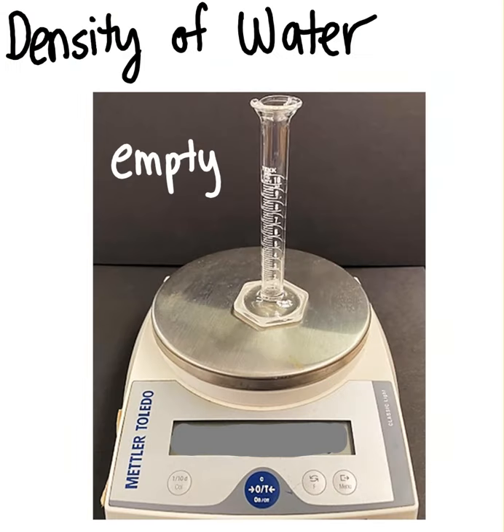Next, on the experiment, we're going to determine the density of water. On this one, we need the mass of the empty graduated cylinder. So nothing's in there. This mass is our data point E. And of course, it's in grams.